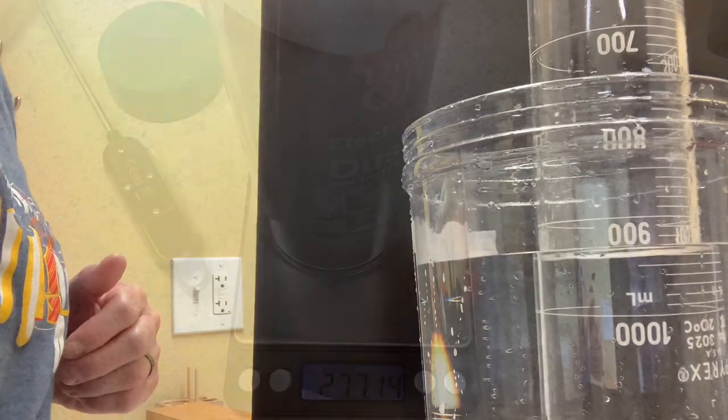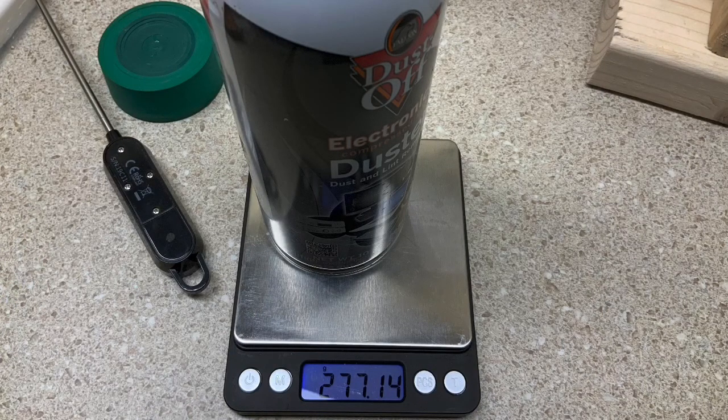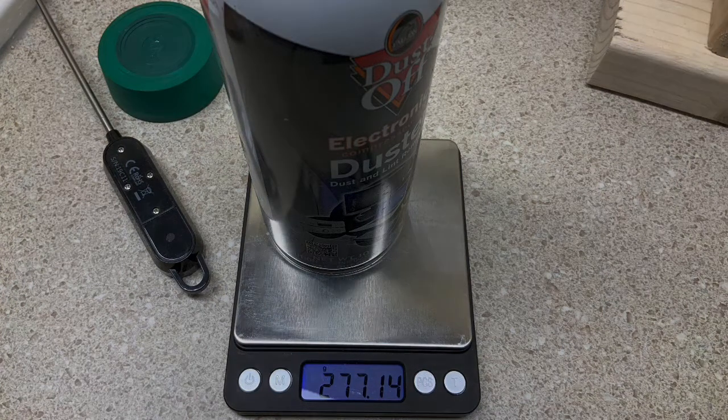And now a final measurement of the canister after the removal of the gas.